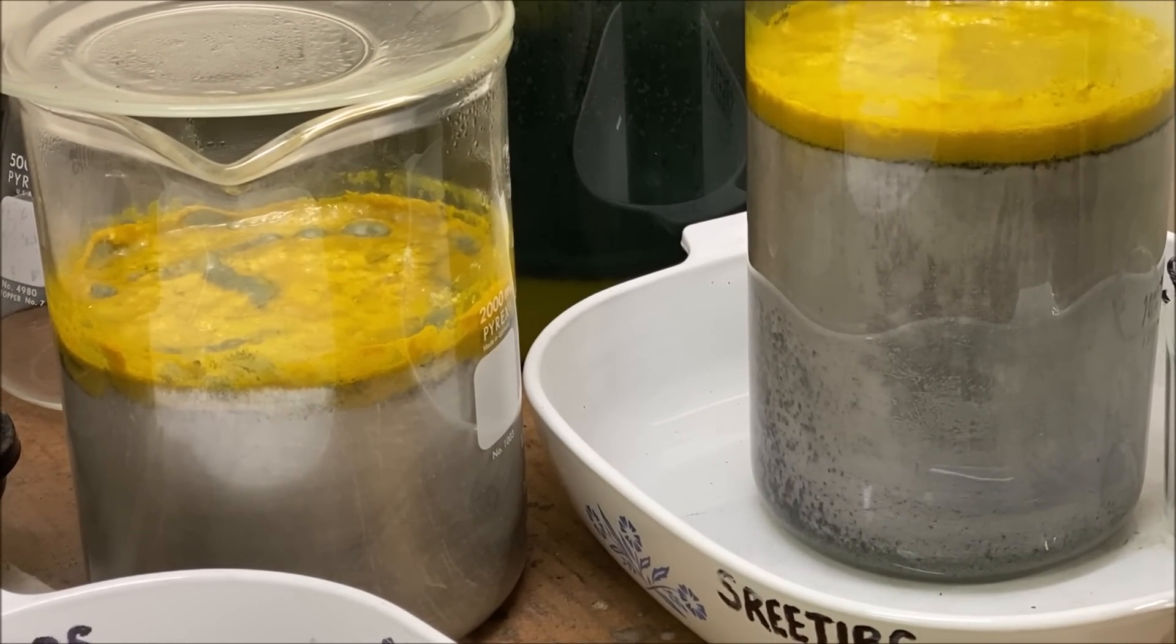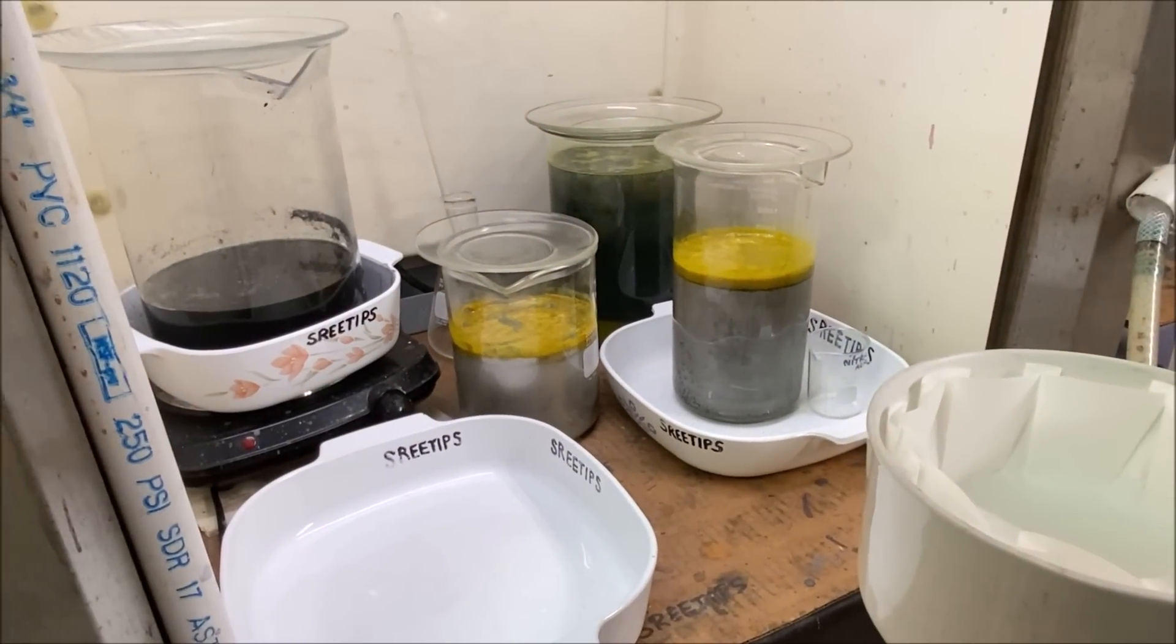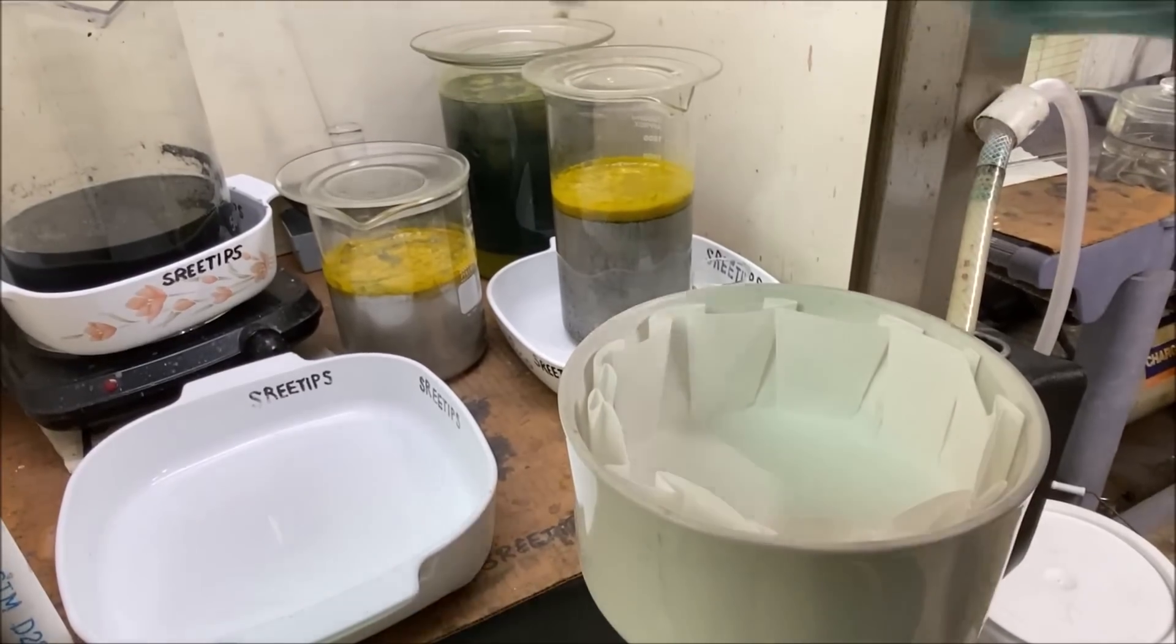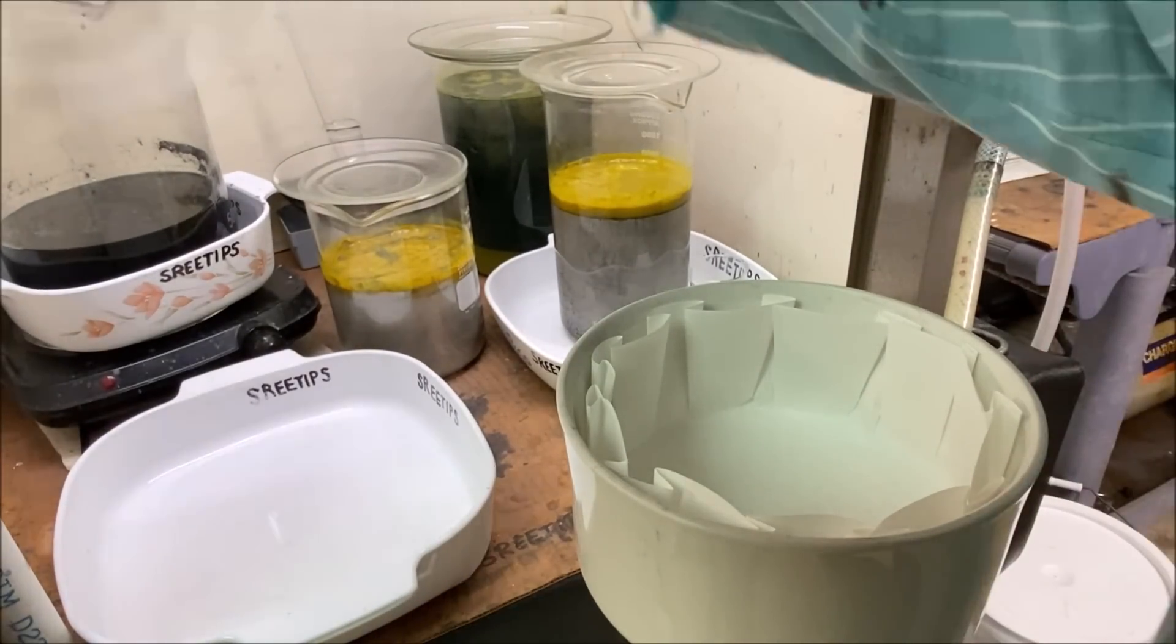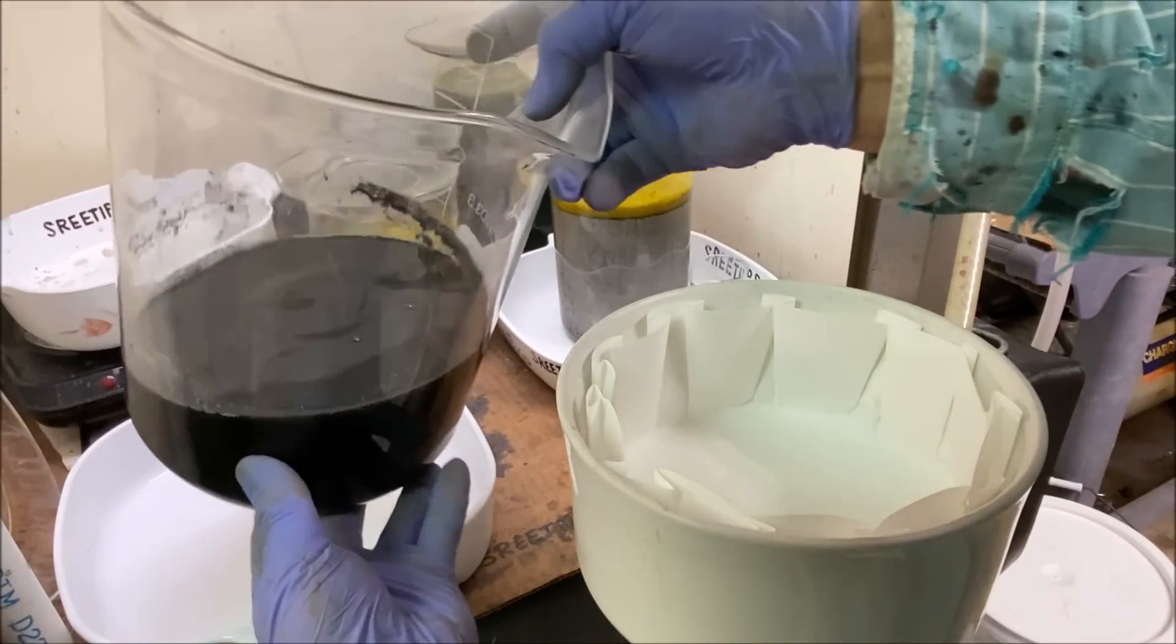We've precipitated out the palladium with dmg, so we'll have to deal with that. For right now, what we're going to do is take this liquid right here.